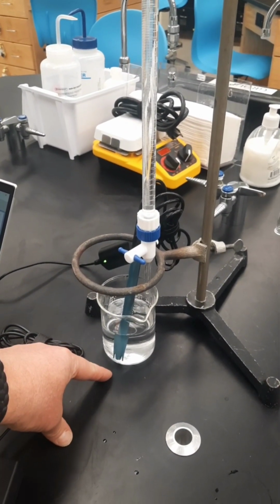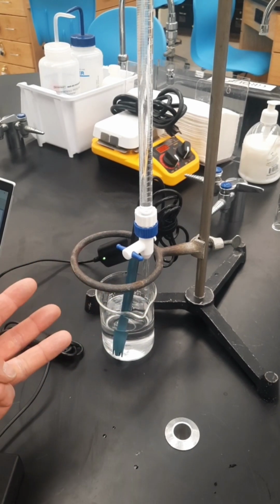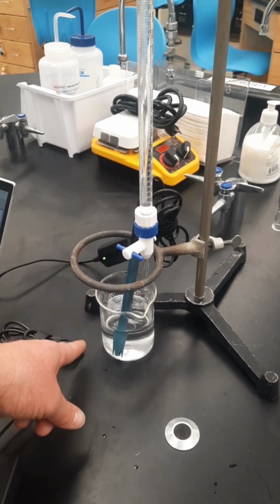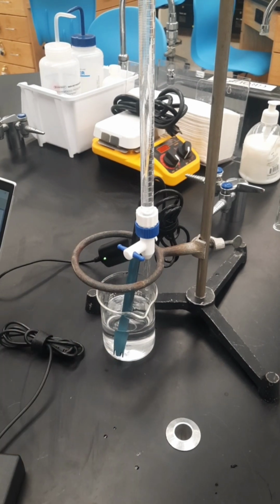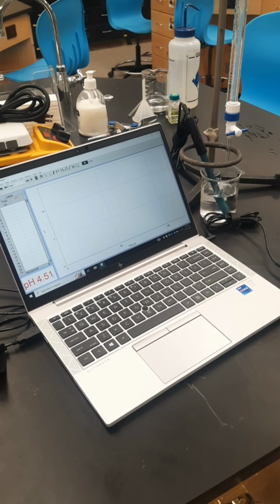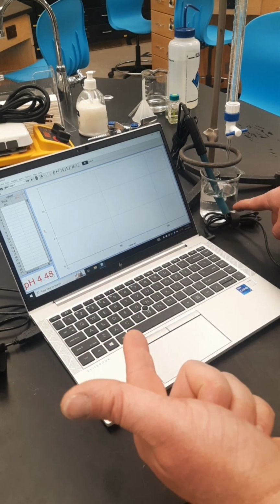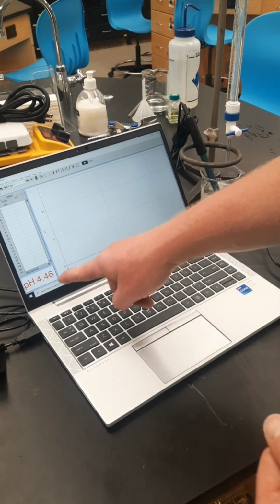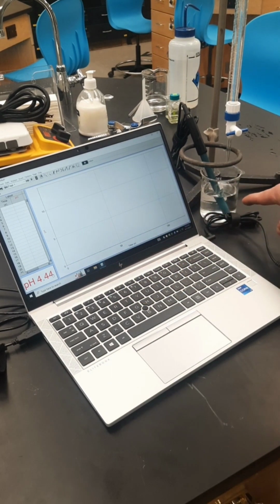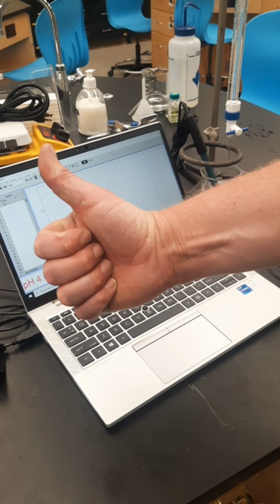You have a known mass of your unknown acid. You have 3 to 5 drops of phenolphthalein. You have enough water in here to completely dissolve the acid. Doesn't matter how much, just make sure it's enough water. For the setup before you begin the experiment, we have our indicator, our known mass of acid, and enough water in here to dissolve it. We have a base in here filled all the way up to 0.00. We have our calibrated pH electrode. We know there's a weak acid in here, so the pH being less than 7 is all good to go.